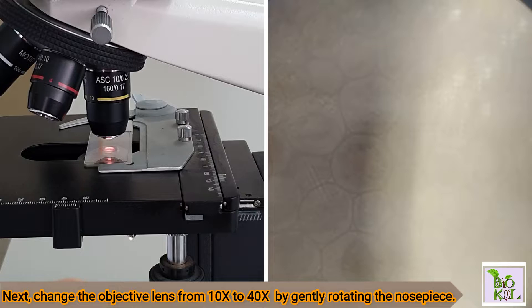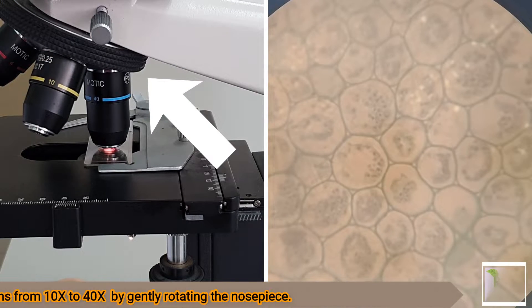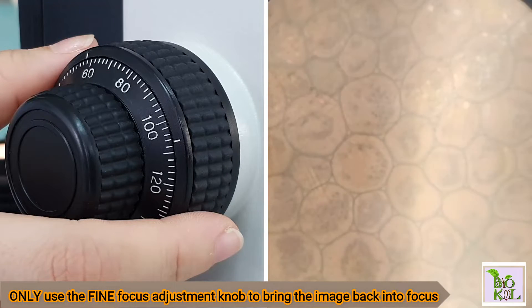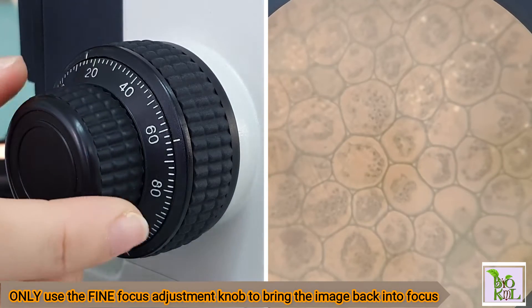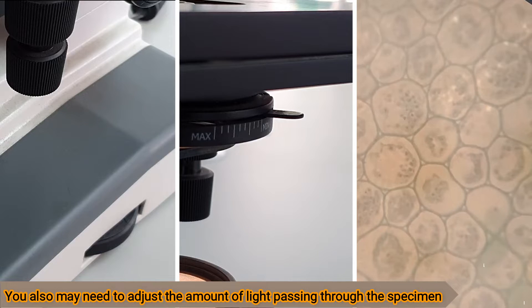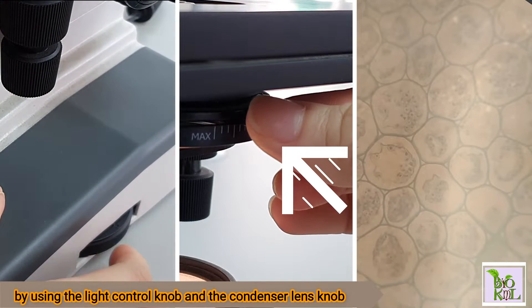You may also need to adjust the amount of light. Next, change the objective lens from 10 times to 40 times by gently rotating the nose piece. If the image becomes blurry and out of focus, only use the fine focus adjustment knob to bring the image back into focus. You may also need to adjust the amount of light passing through the specimen, using the light control knob and the condenser lens knob.